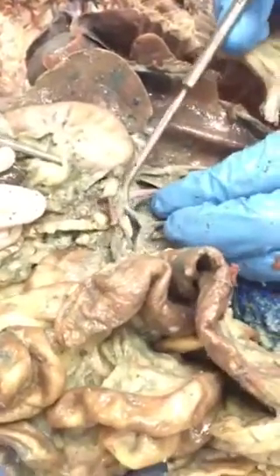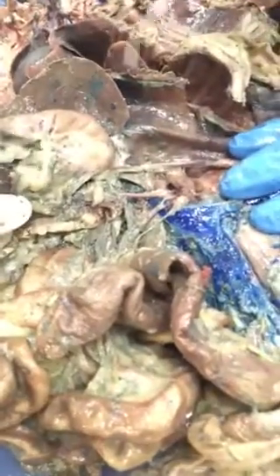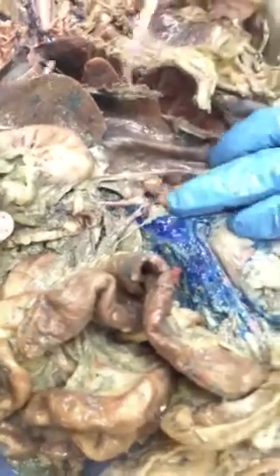And I would hopefully find a cat that's not as green as this, because you can see that it's going towards the stomach and the liver and the spleen. The spleen's over here, right? Is this it? Yes. Okay, I just want to make sure. And what is this? That's the pancreas. Okay, perfect.